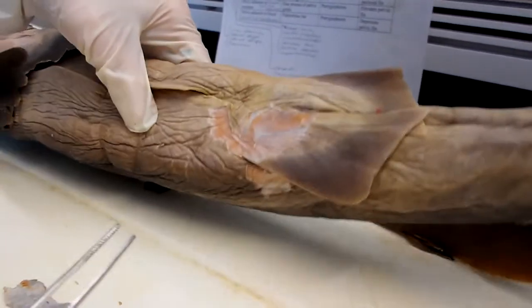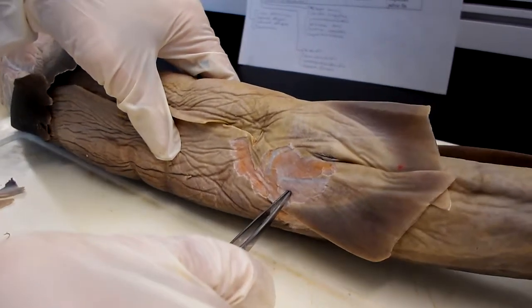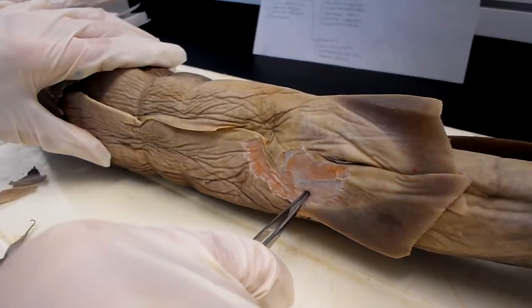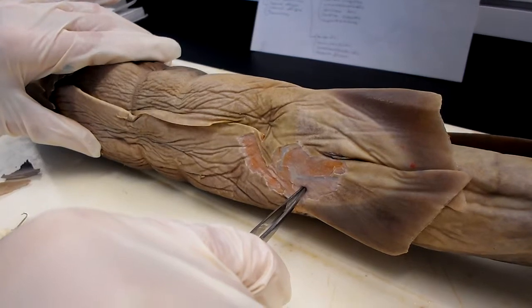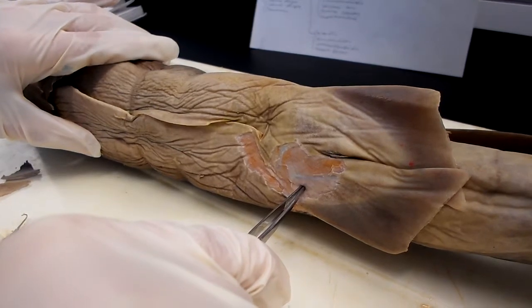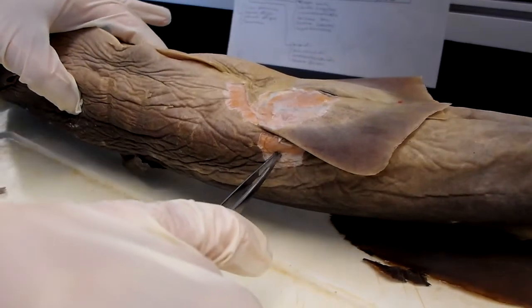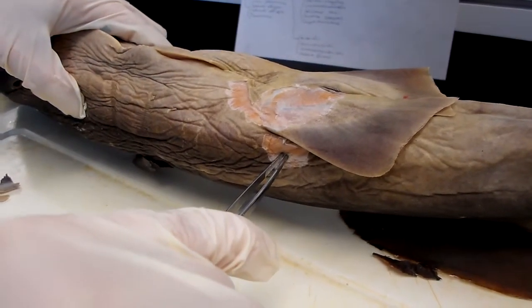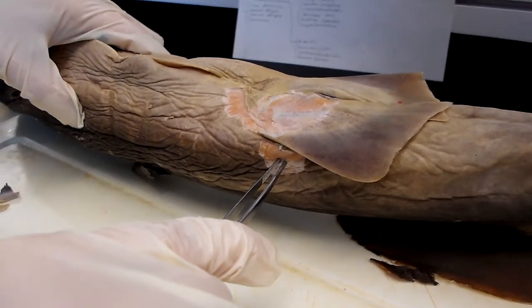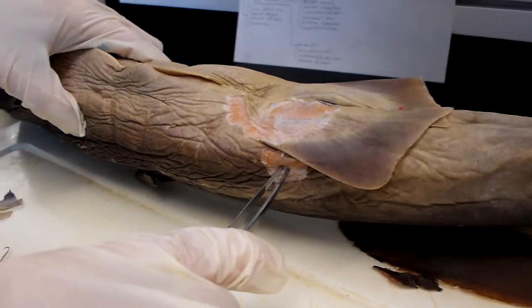The pelvic abductor and extensor is here, and it originates at the iliac processes of the pelvic girdle and inserts at the pterygiophores, and is homologous to several hind-limb abductors. And then the flexor is that side, and originates at the puboischiadic bar and inserts at the pterygiophores, and is homologous to several hind-limb adductors.